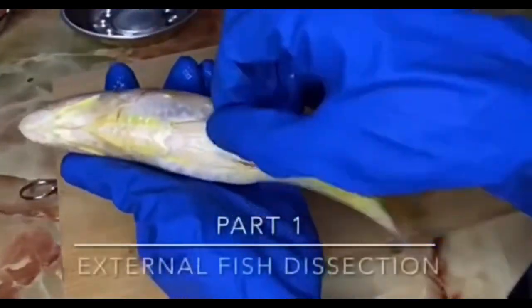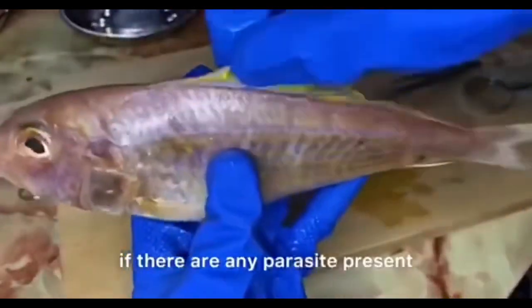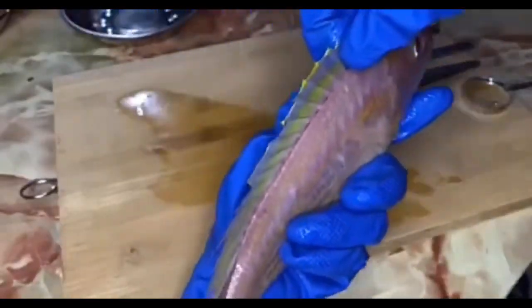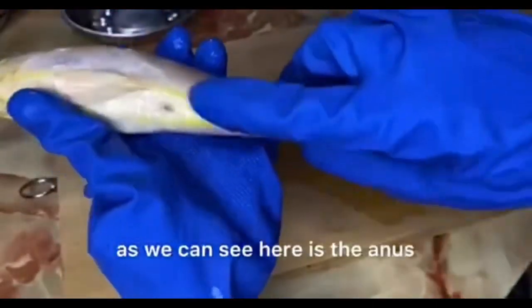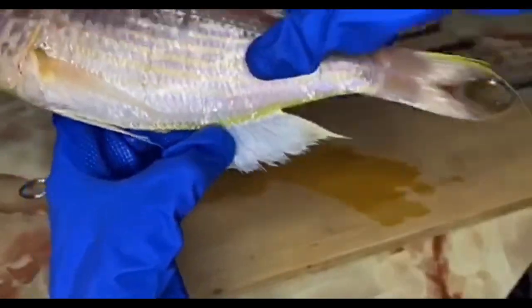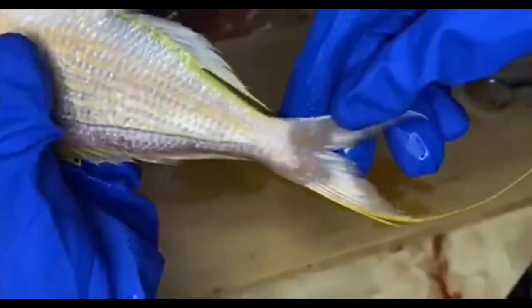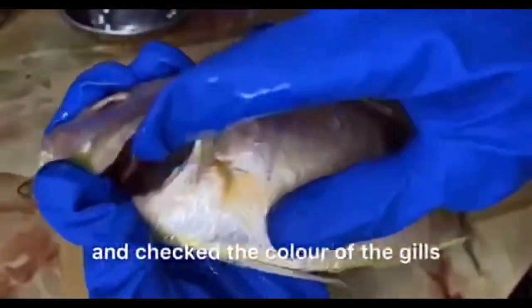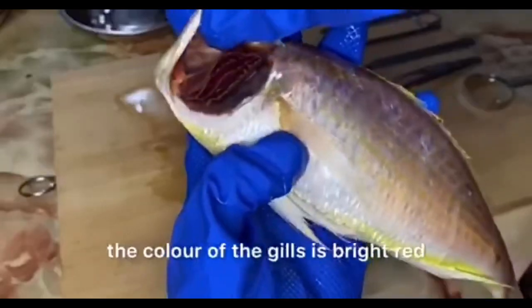Part 1: External fish dissection. Firstly, I check the pectoral fin if there are any parasites present. Then the dorsal fin. As we can see here is the anus and here is the anal fin. The caudal fin. Also, I lifted the upper operculum and checked the color of the gills. The color of the gills is bright red.